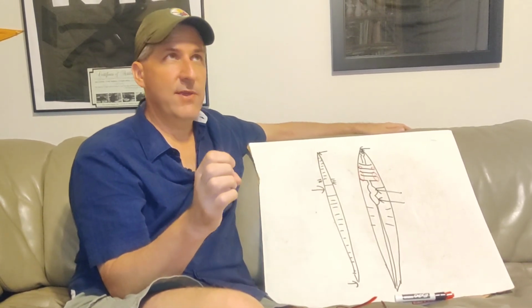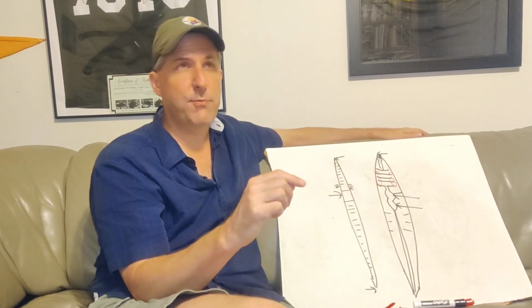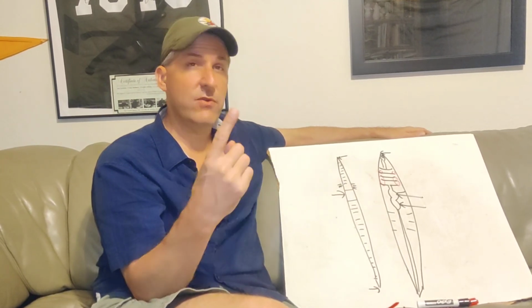I'm trying to think if there's anything else to earthworm I need to talk about. I don't believe so. So that ends the pre-lab for Coelomate Lab number 1. Next time I'll go over Coelomate Lab number 2 pre-lab, which would include the dissection of the grasshopper, crayfish, and sea star. See you then.